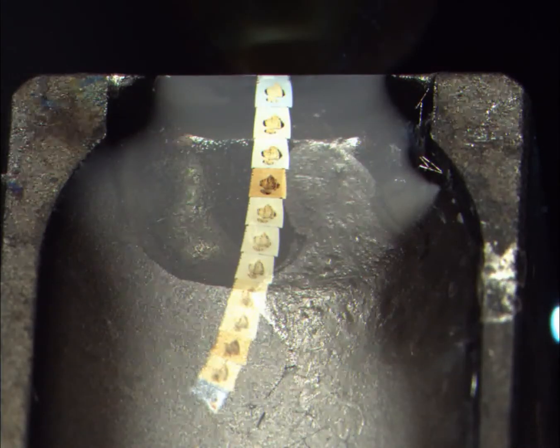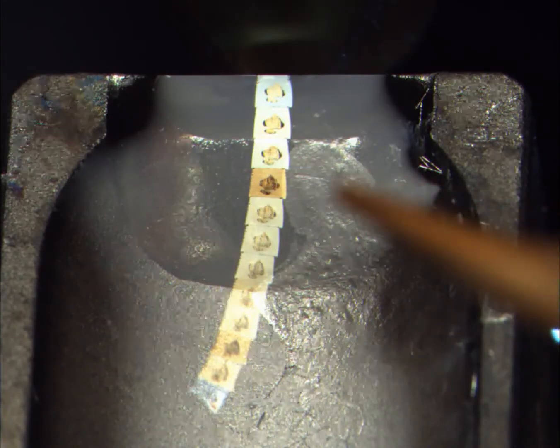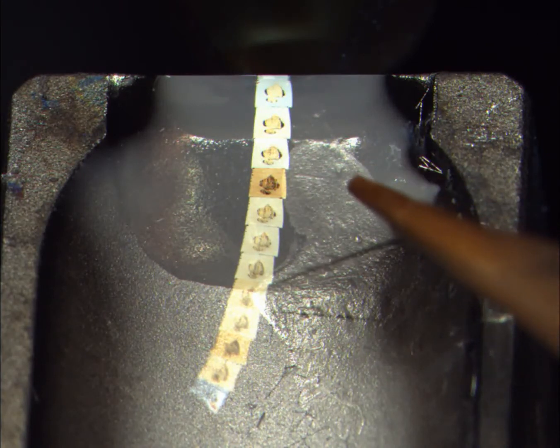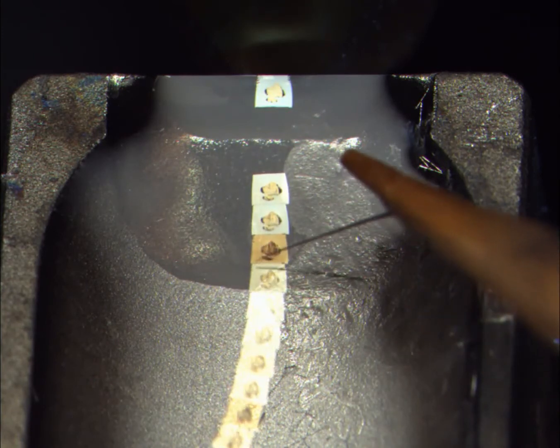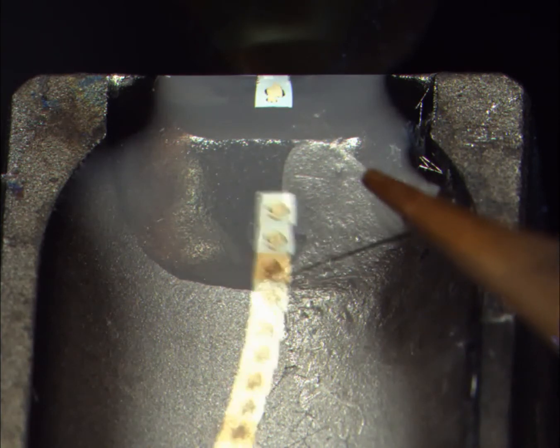Once we have identified our area of interest we can return to the ultra microtome. This time we are using a diamond knife to cut ultra-thin sections of the sample approximately 90 nanometres thick, giving a gold and silver colour.